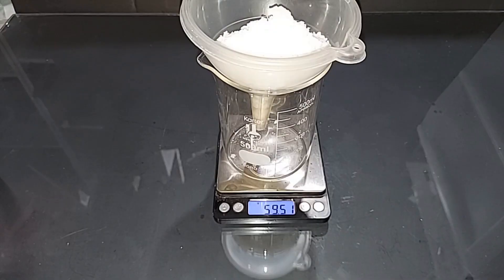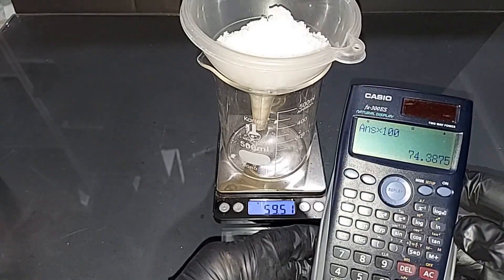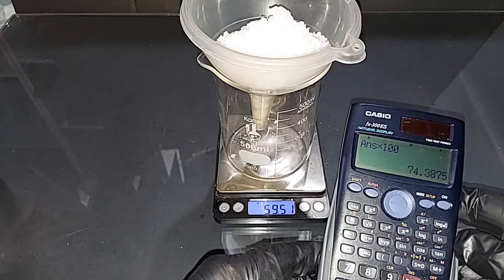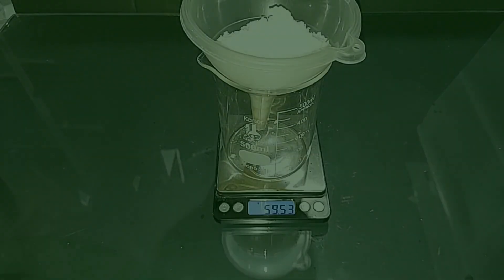59.51 grams. The theoretical yield was 80 grams, so let's do this real quick: 74.39%, so almost 75 percent. Not too bad I would say, I think that'll have to do.